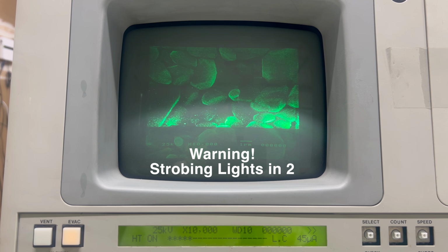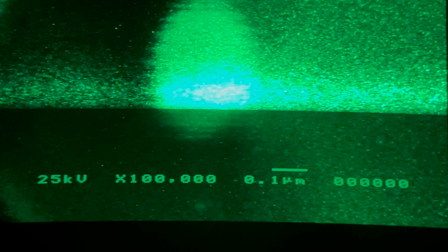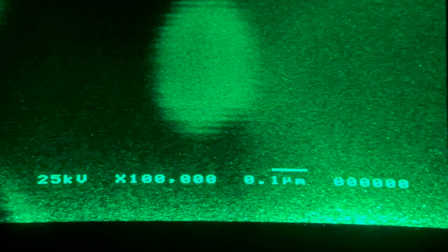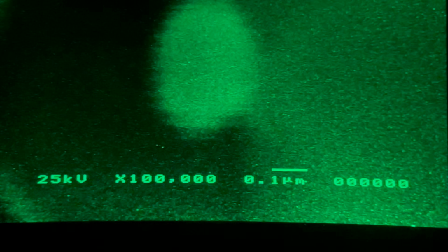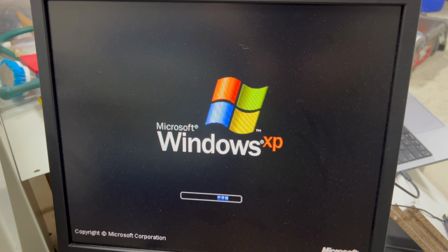Let me find a really small one and zoom in more. Here we are at 100,000 times magnification. This particle is about 200 or 300 nanometers wide. Those wavy edges are actually caused by vibrations, which is something I'll need to reduce if I want to improve the resolution further. By the way, remember the computer that I showed earlier?